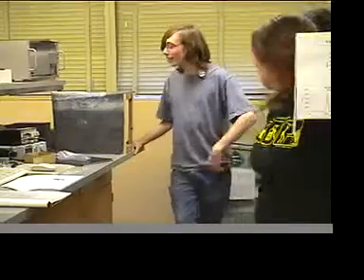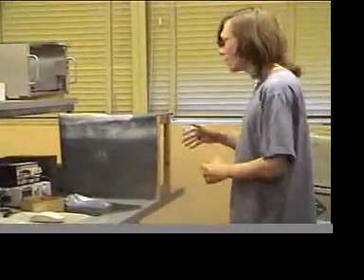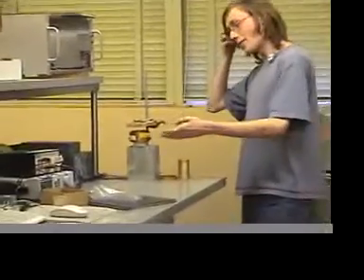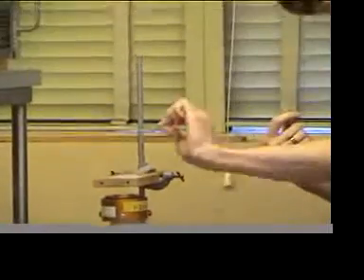Kevin? Thank you. So behind this shielding, which is here to protect us, is our americium source. Here, can you move this out of the way so you can see this right now? So here's the americium source. It emits gamma rays. The gamma rays come up and strike our sample, which in this case is iron.